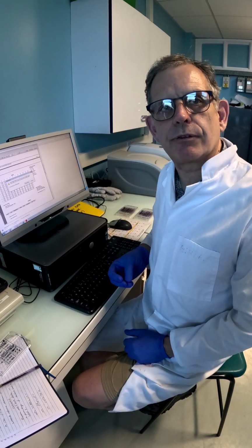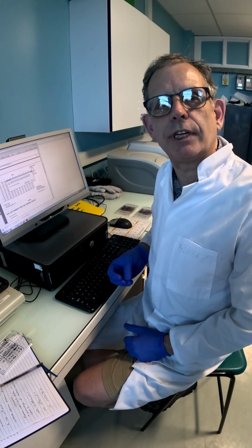I hope this has proved useful for you understanding the workings of the MTT assay.